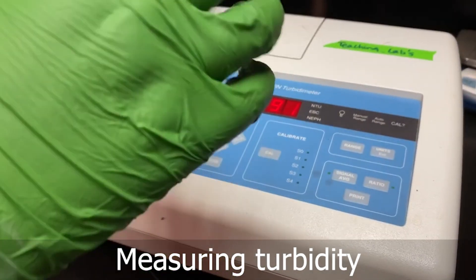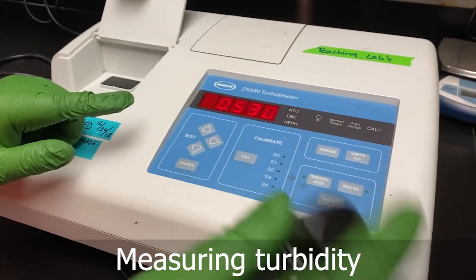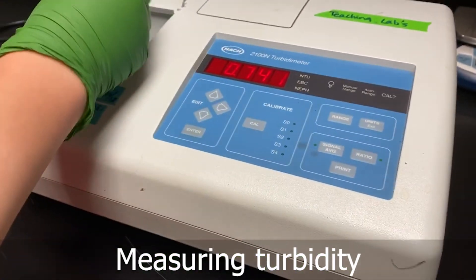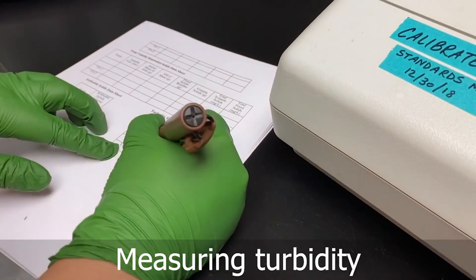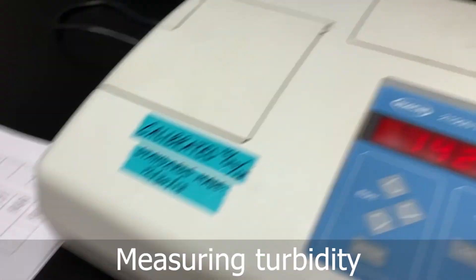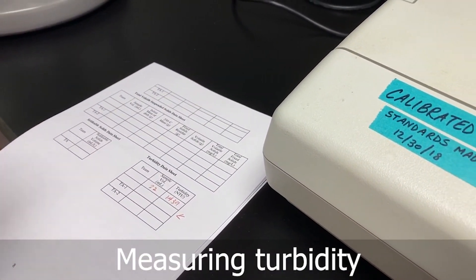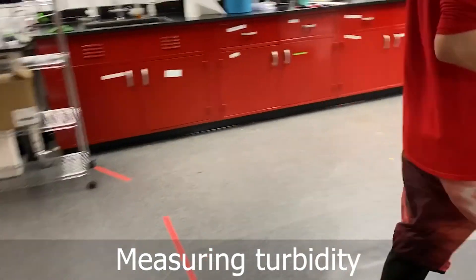But we know that the solids are trying to settle down, so the turbidity will change. So we just shake it before we put it in and then we get the first reading. The volume is 22 and the reading is 1439. This will keep changing but it doesn't matter, and then we do it for the second time.